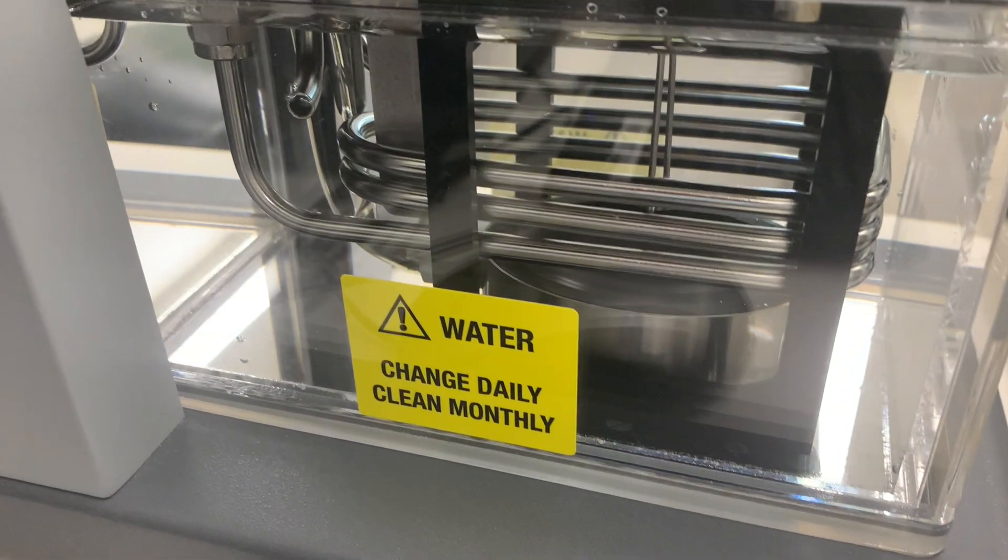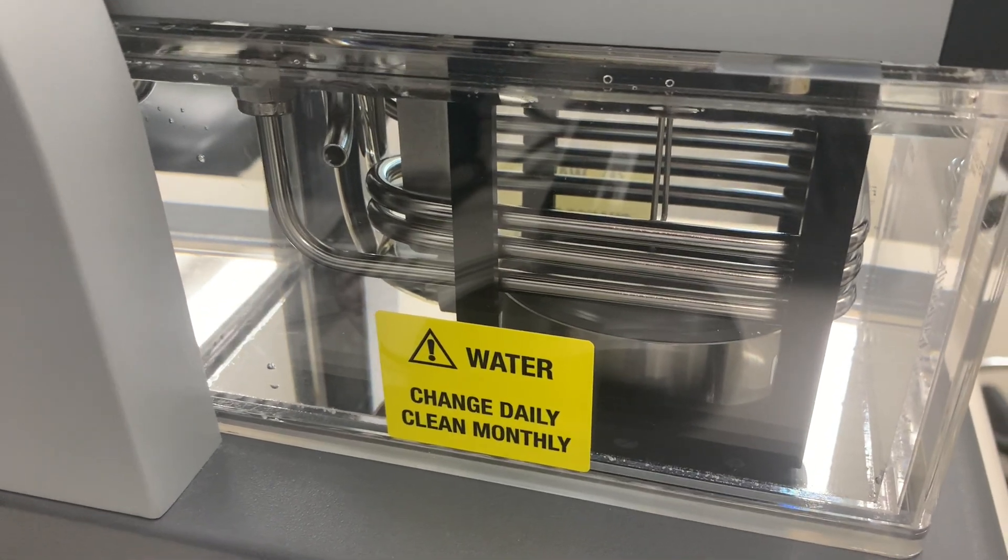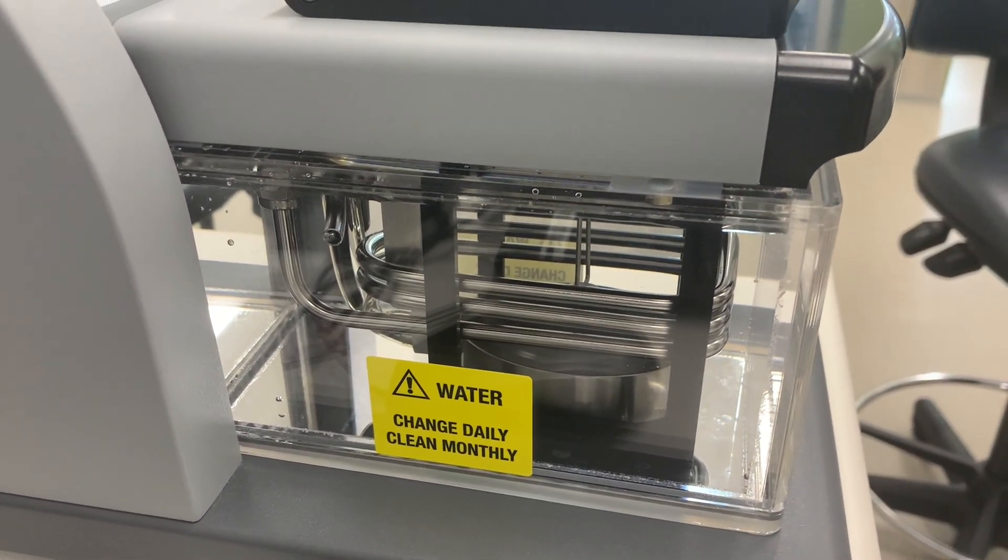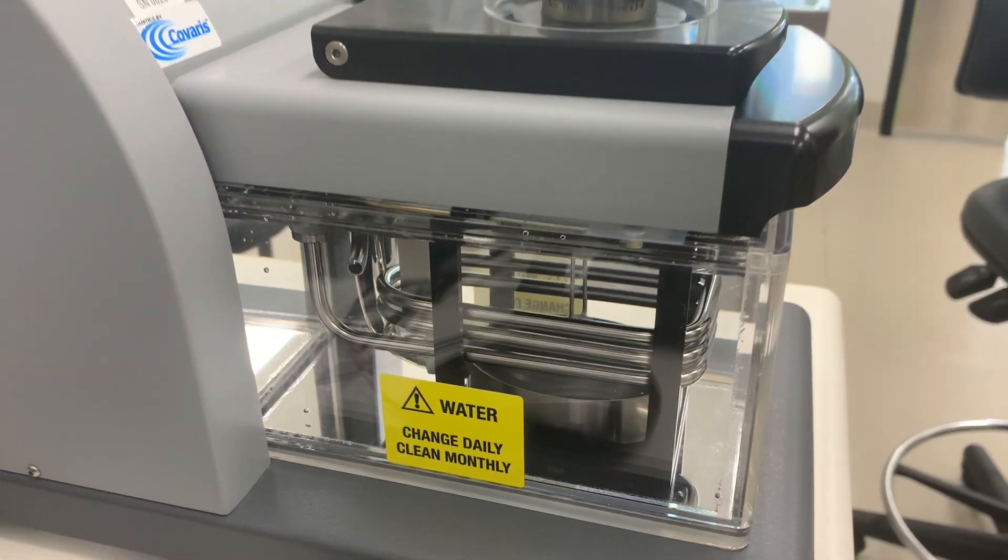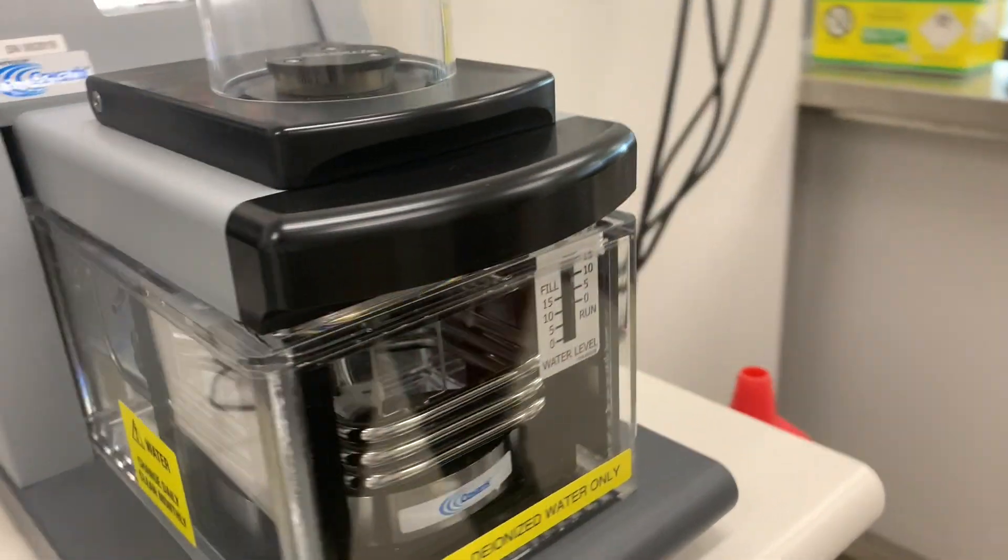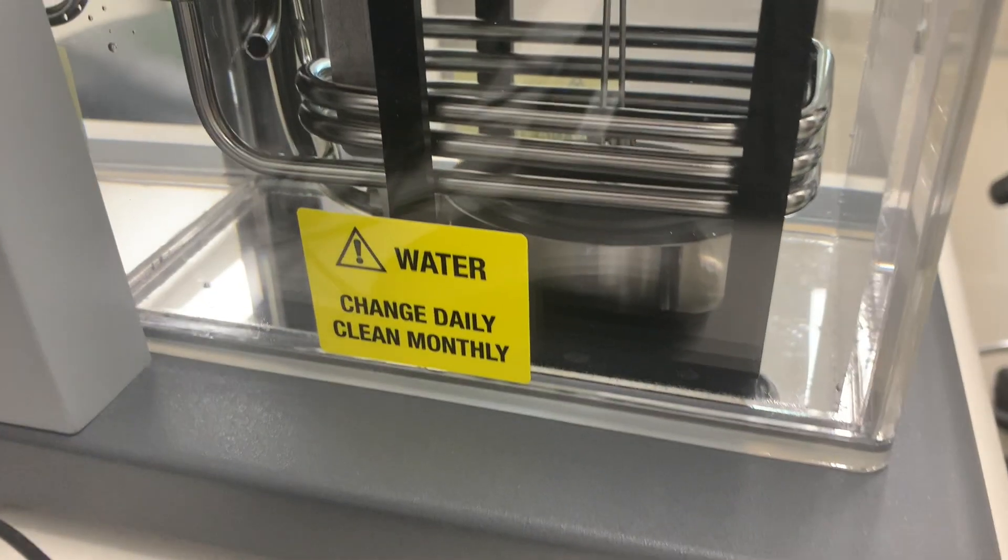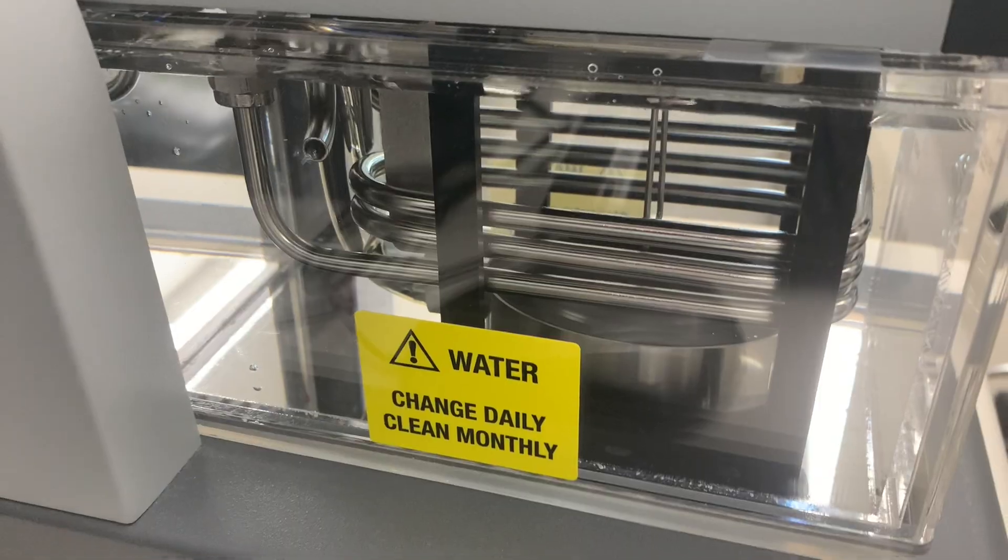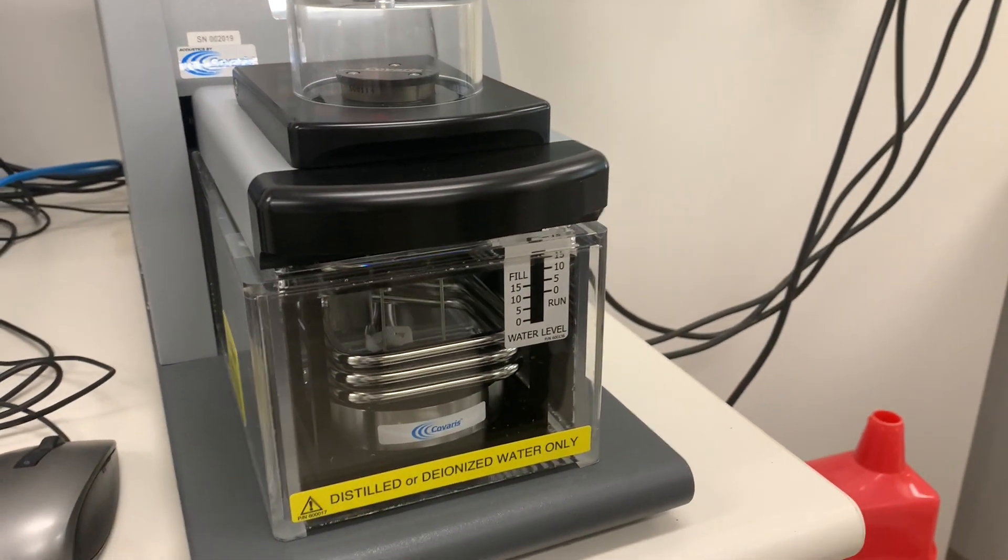Before the program can start, it will degas the deionized water. This is because it doesn't want anything in its way when it's creating the ultrasound waves. You will see these bubbles coming out which indicates to you that it's working, it's degassing the deionized water.